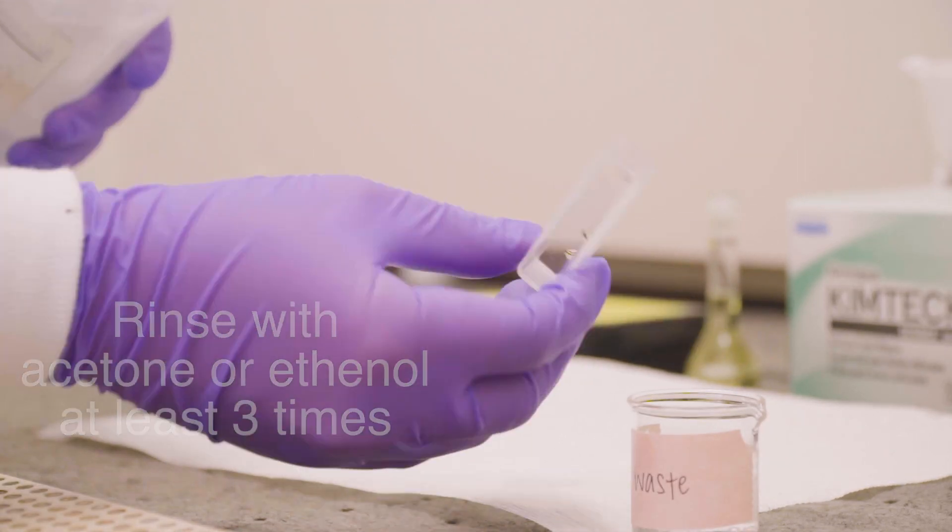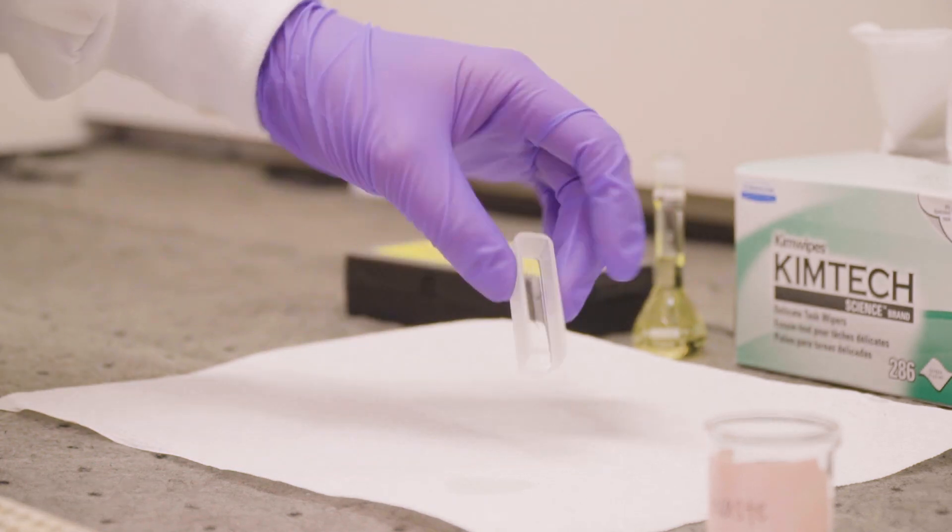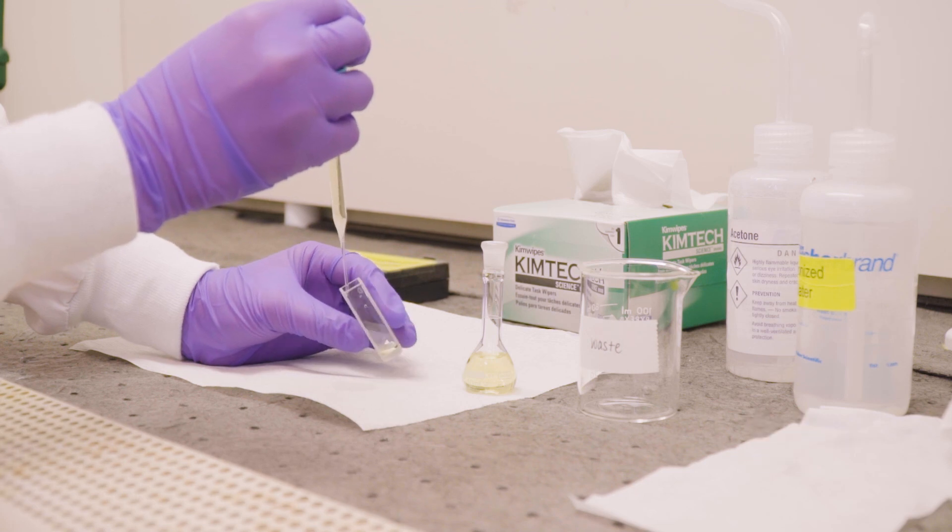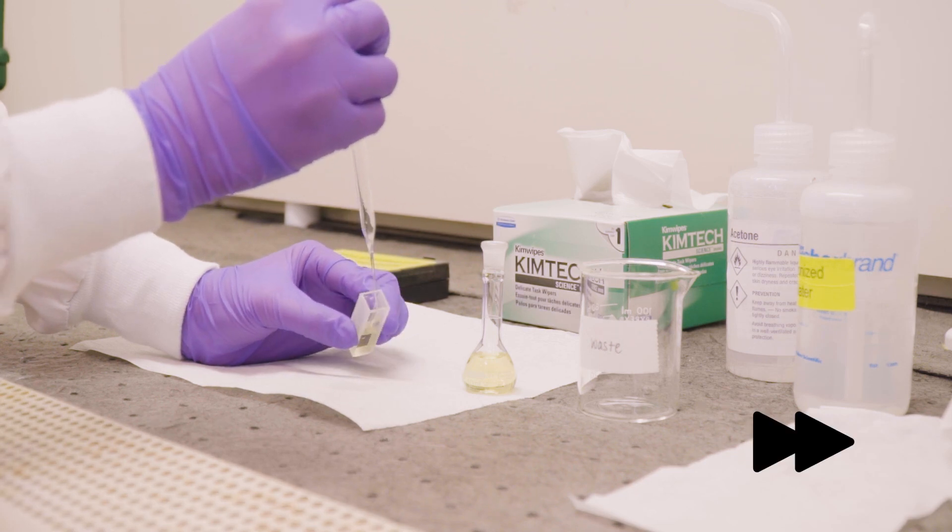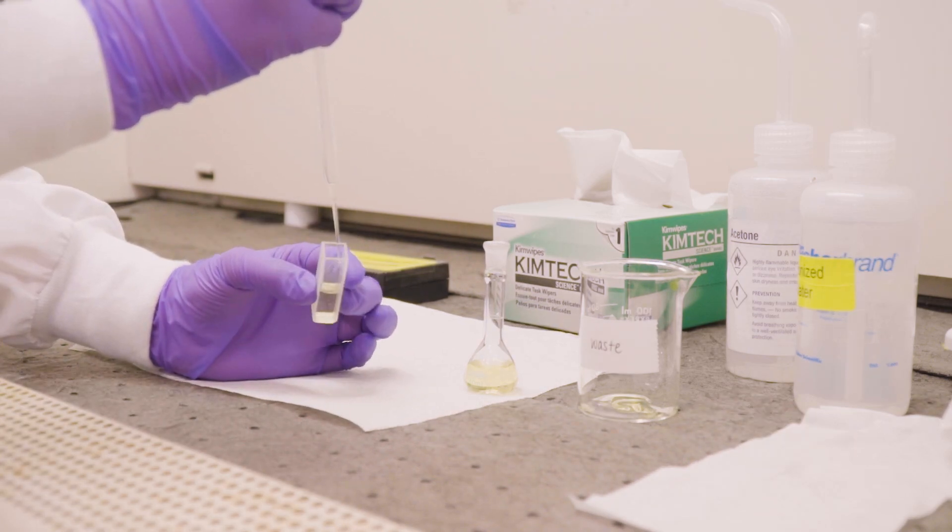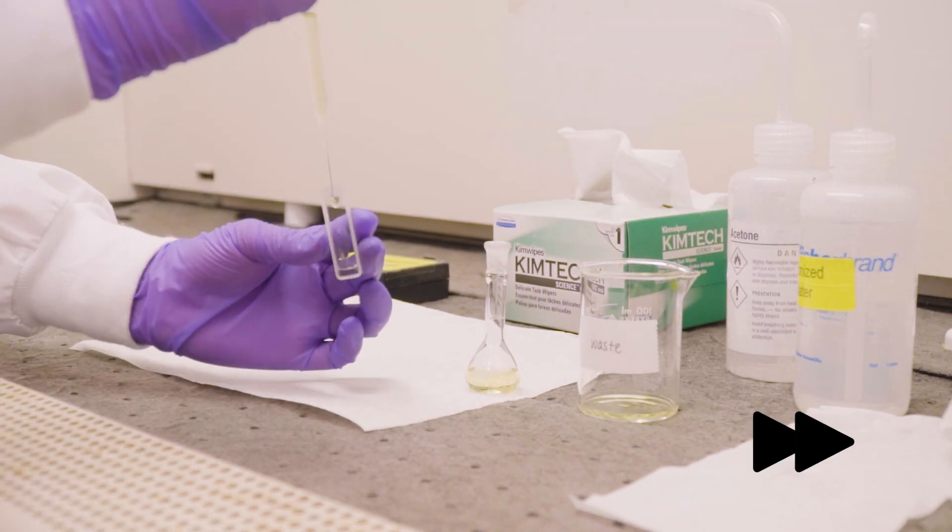You can either air dry the cuvette by letting it stand upside down on a clean surface or use a sample solution to rinse it two to three times if you need to use it immediately. Rinsing with a sample solution ensures there is no leftover water or solvent that could dilute your sample during analysis.